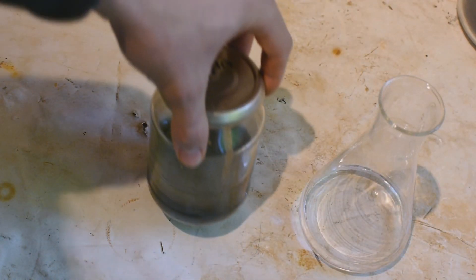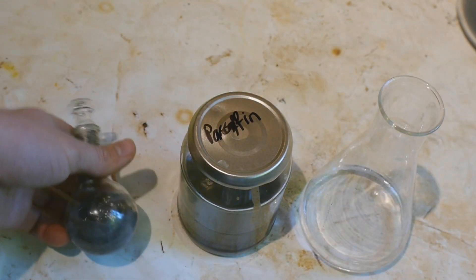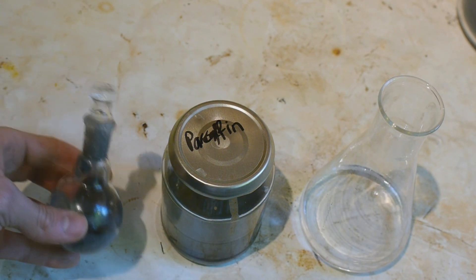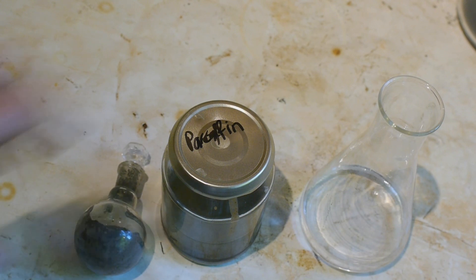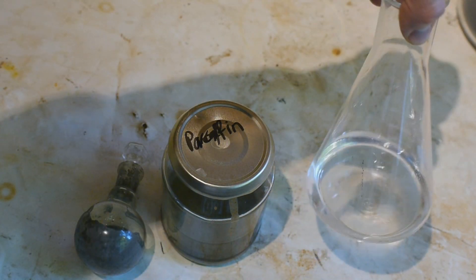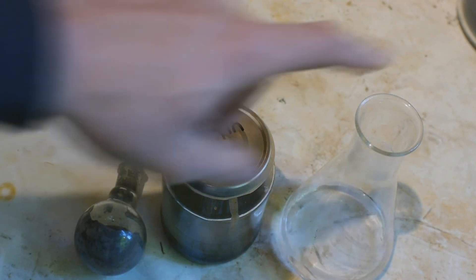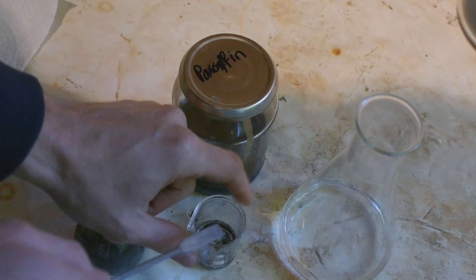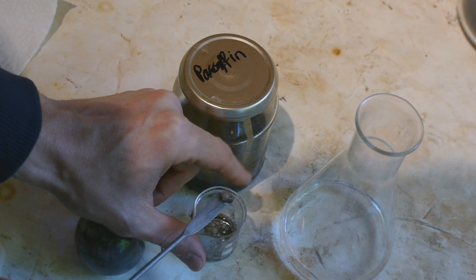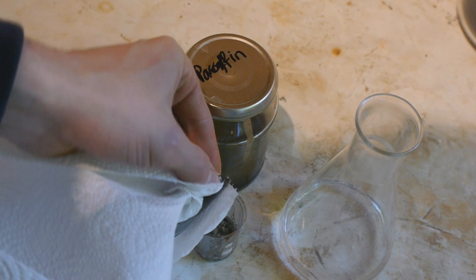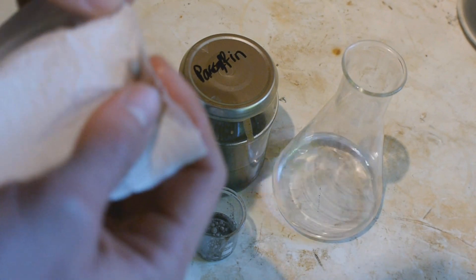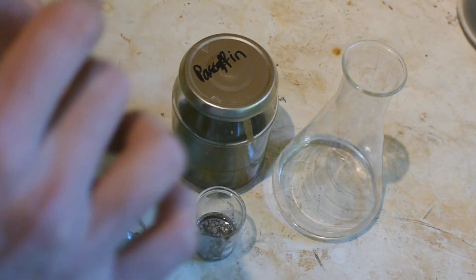So now we are getting to our very last resort. And that's the stuff we made from the first batch, and that's the stuff that we sieved off. So this should still contain a lot of sodium. This should at least contain 5 to 10 grams and this is maybe 2 or 3 more grams. It should be enough for dioxane separation with this dioxane if we reflux it for a while. So let's first of all make double sure that this dioxane is dry. So to make sure that the dioxane is dry, I have here, let's take one of the bigger beads from the very first run and wipe off all of the mineral oil. And now let's drop this bead into the dioxane.